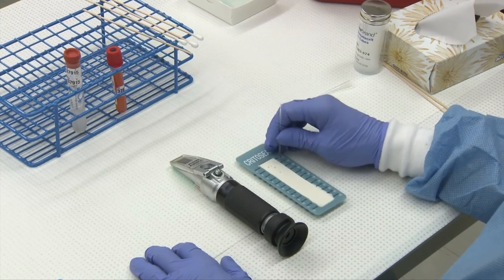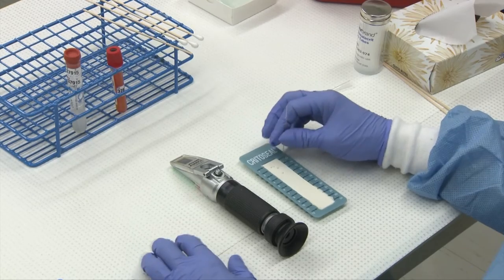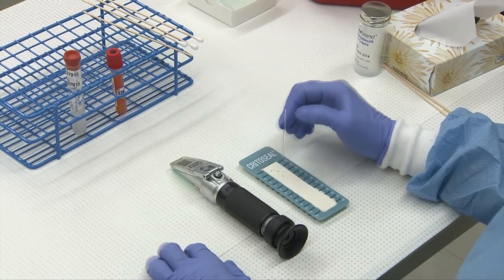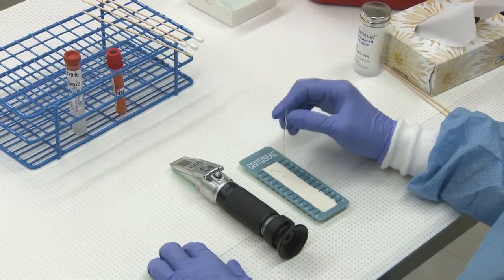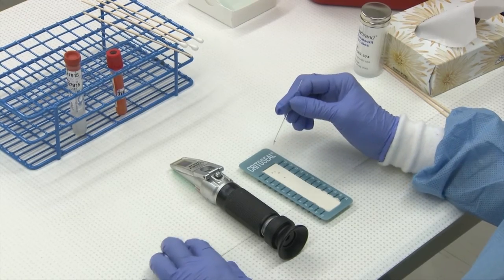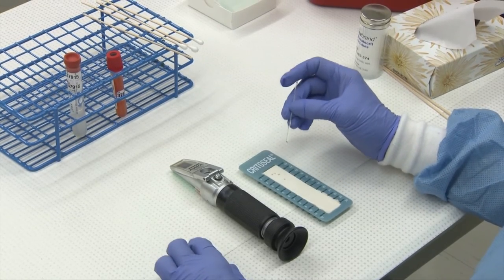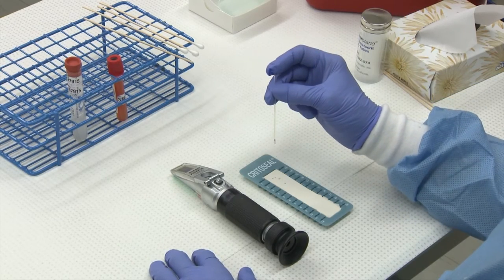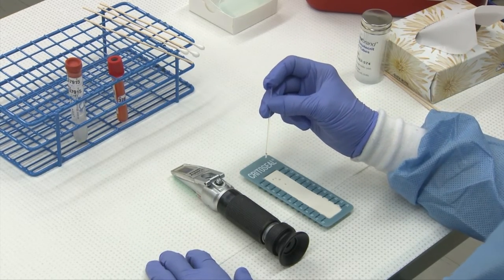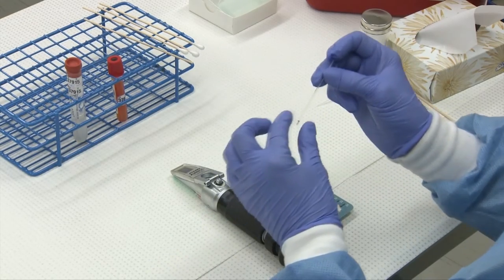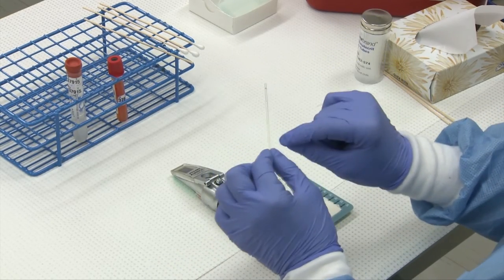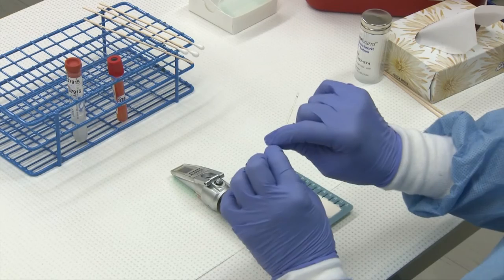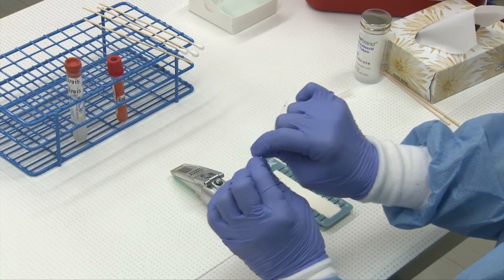If you have a body cavity fluid and you want to determine whether you are dealing with an exudate, a transudate or a modified transudate, one of the steps that you'll want to do is a protein by refractometer. So you'll spin your sample down in your micro-hematocrit centrifuge and break it anywhere along the tube that you're going to have enough sample to flood your platen with.